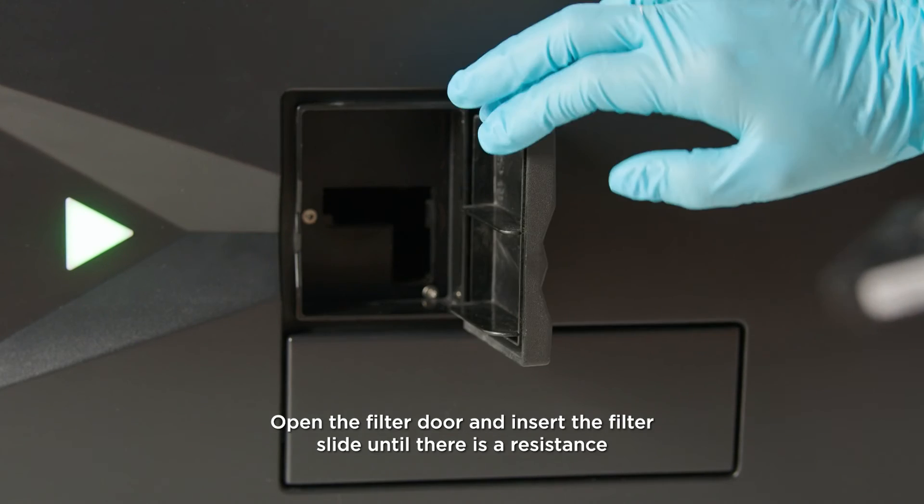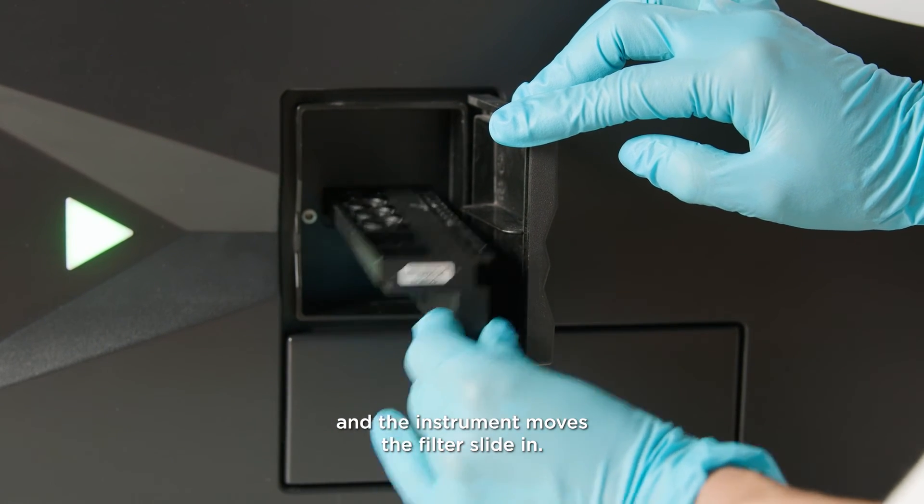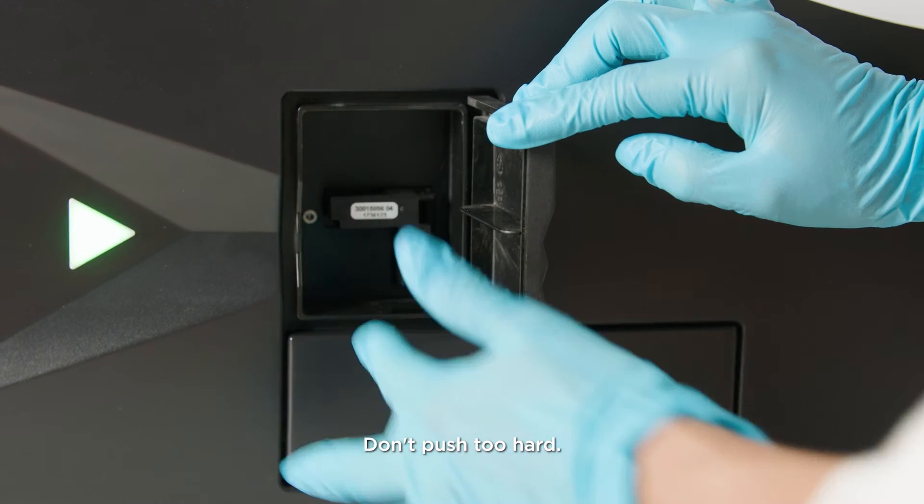Open the filter door and insert the filter slide until there is a resistance and the instrument moves the filter slide in. Don't push too hard.